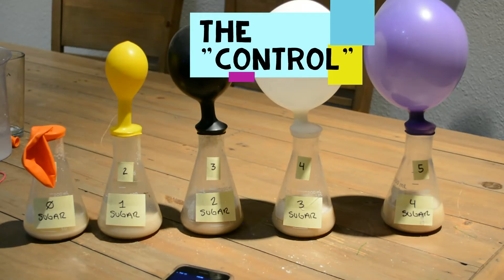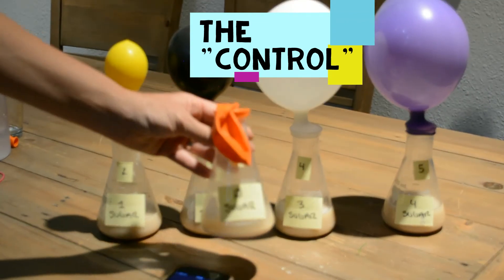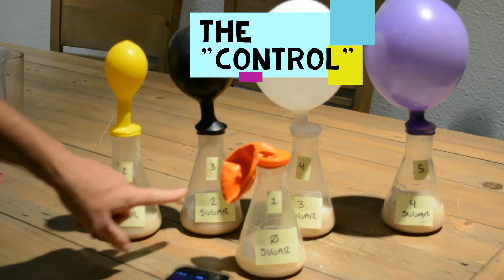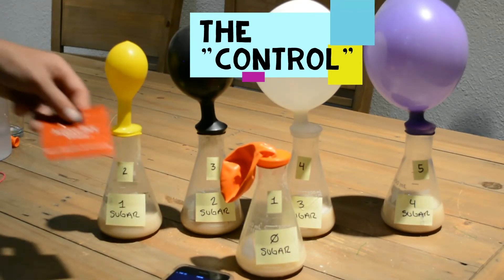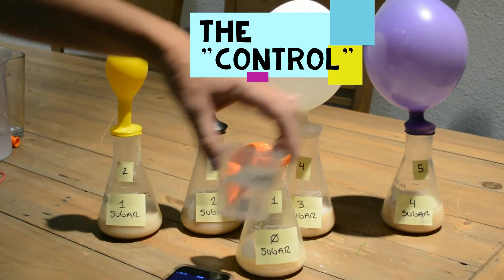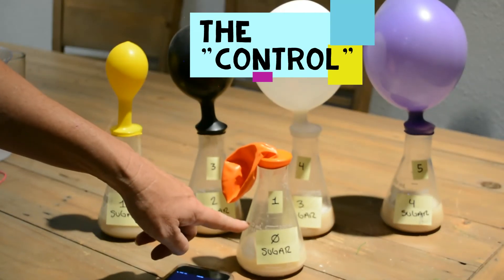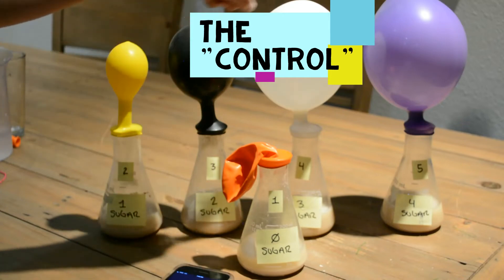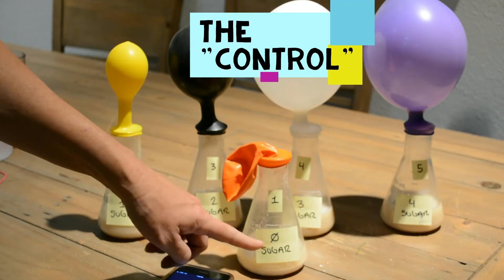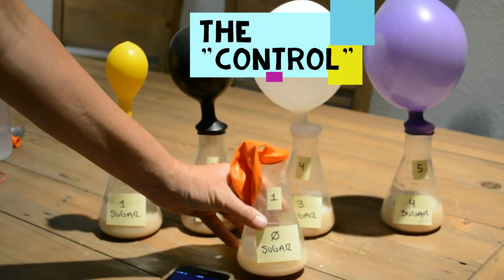While we're waiting for the 20-minute mark, let's talk about what's happening. Why is the zero-sugar beaker not rising? This beaker has no CO2 whatsoever in its balloon. All beakers got one teaspoon of dry active yeast and 100 milliliters of water, but the only difference for beaker one is that it has no sugar. So what is it considered? This is your control group — group one is your control.